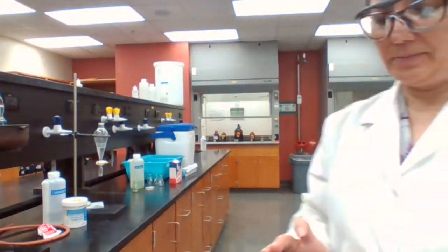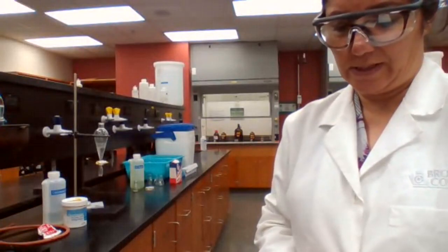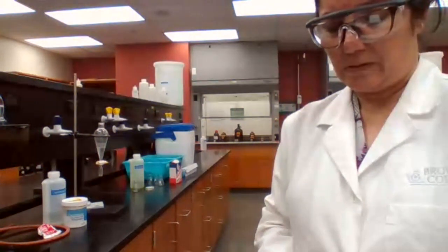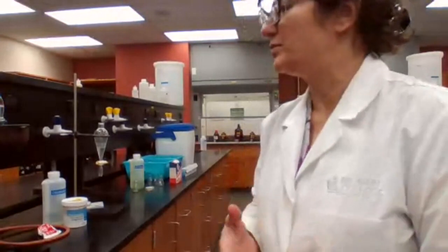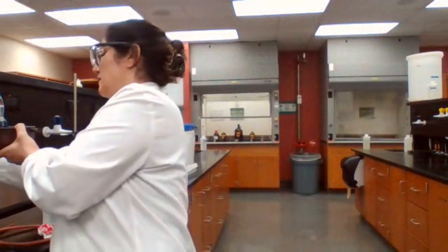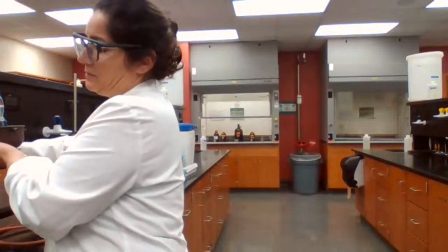Okay, I need to get some calcium chloride. It is not here. And our lab tech is not here. So I'm going to have to go back to the prep room. We're not receiving yet, but definitely boiling has started.